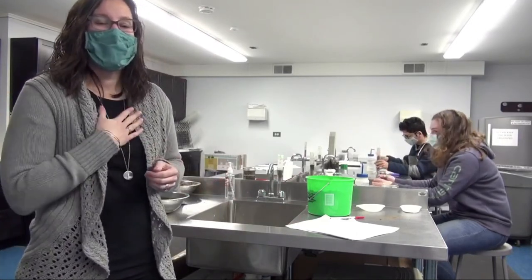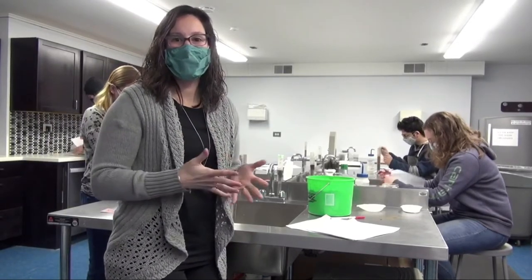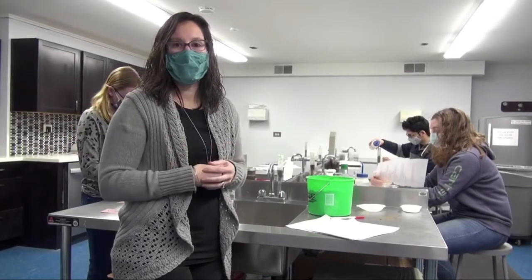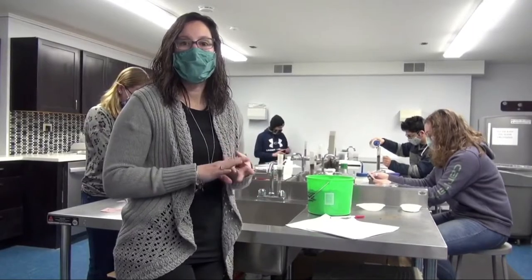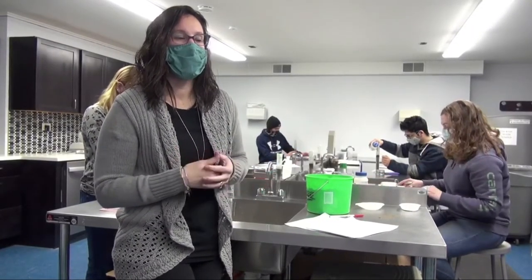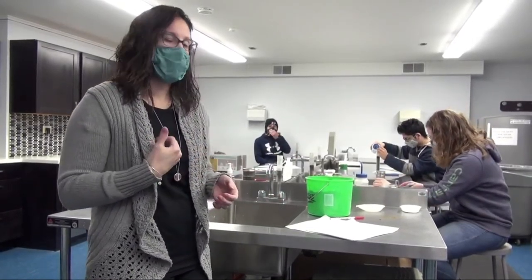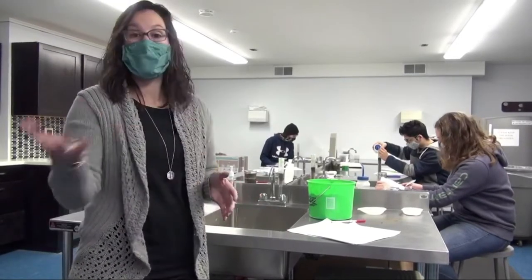So today, I've invited you to my basic soils class, where I have students in the lab working on two different soils labs at the beginning of the semester here. There's a couple things that we try to focus on at the beginning of the semester, and that is kind of soil basics. So I thought you would be interested in joining us to learn some basics of soil and how it might help you at home.